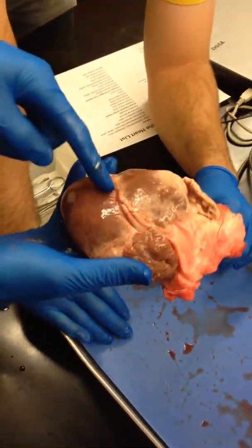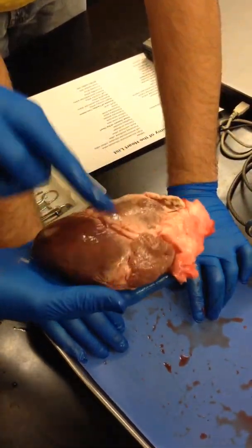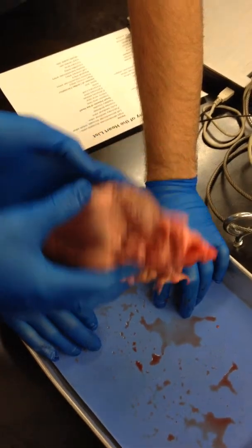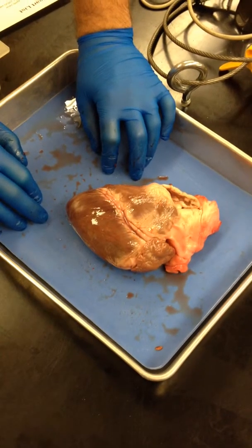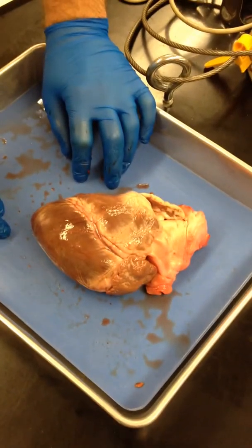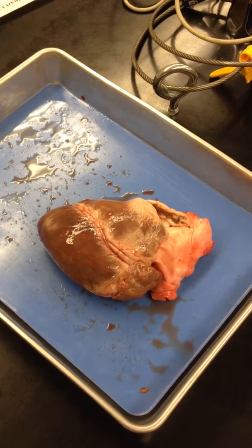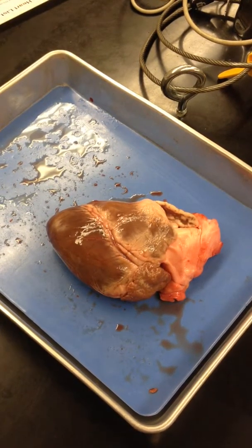Now that you know this is the left and the right — this is the anterior, posterior. See the septum I was talking about? There's an artery and a vein in there. Name those. The right and left coronary arteries — the left coronary artery leads to the anterior. The right goes to the posterior.